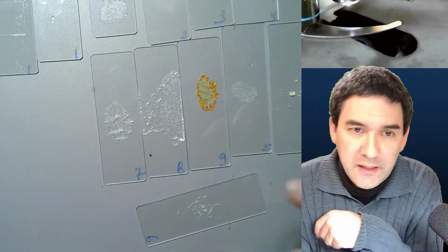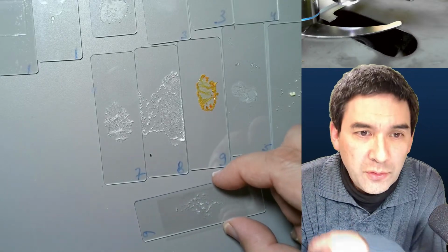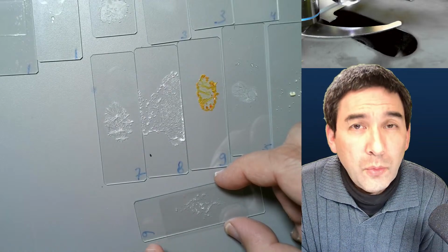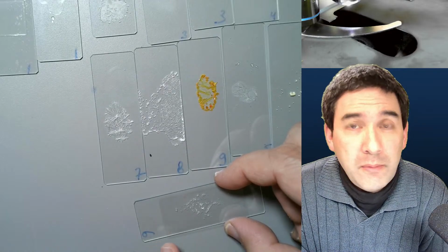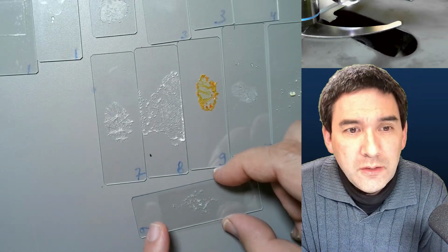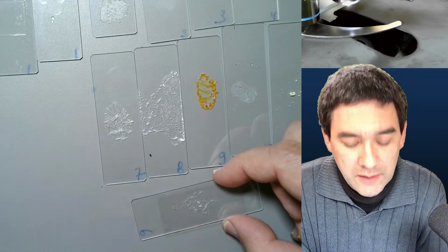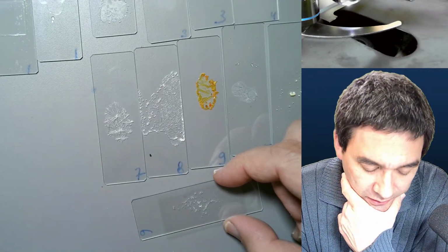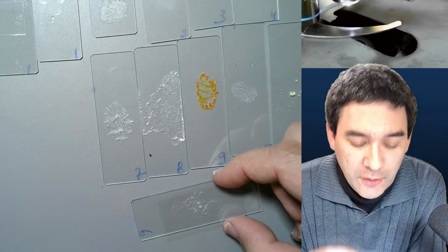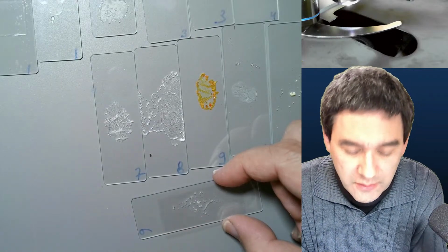If I now take this cover glass, put it on top here, of course I can use sticky tape to glue it down on the edges. But if I use some kind of a liquid glue, or some clear nail polish, which is very thin, what's going to happen is that it's immediately going to flow beneath the cover glass, and it's going to touch the crystals here. So I was wondering, is there not some possibility to connect the cover glass without making the glue or the mounting medium touch the crystals?